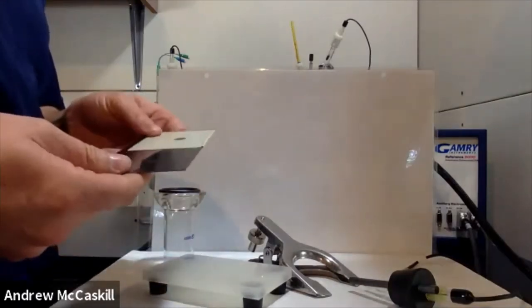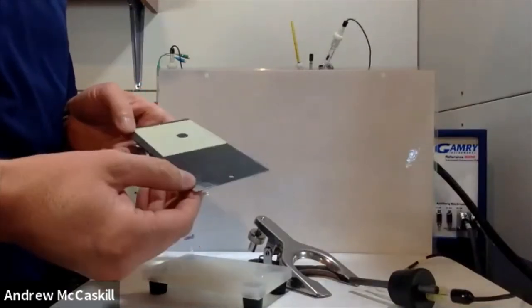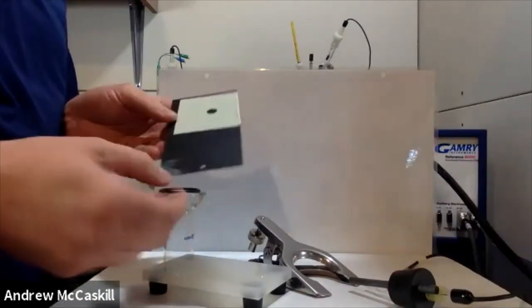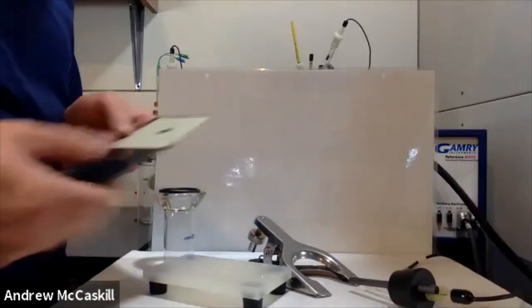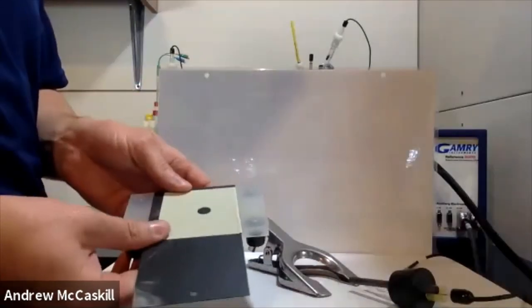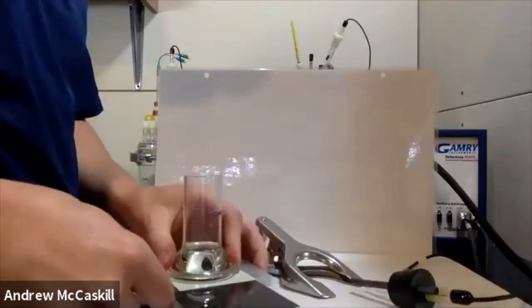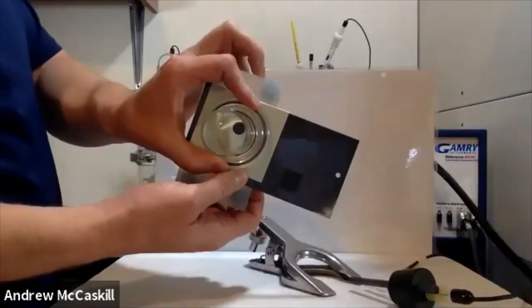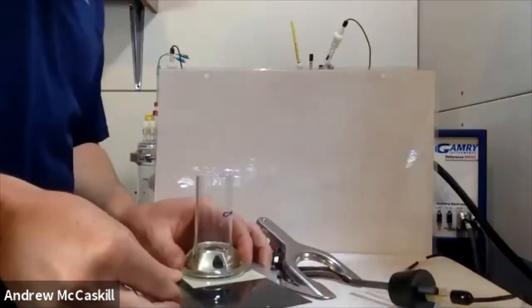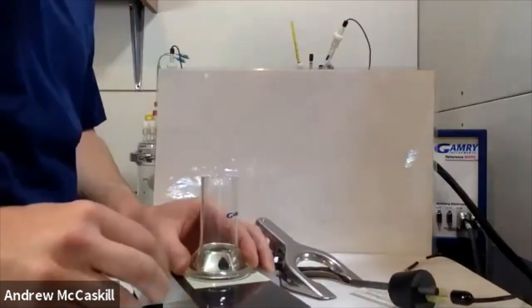What I did first is scratch off the edge right here to expose some of the substrate. If you're testing coated samples like this, make sure you get the exposed metallic substrate — don't try to connect your cables to the coating or your data is not going to be very good. We have our base here and I'm going to set the coated sample right there, o-ring sits on top, and you can see our exposed area of the coated sample down below. That's our working electrode at the bottom of the cell.